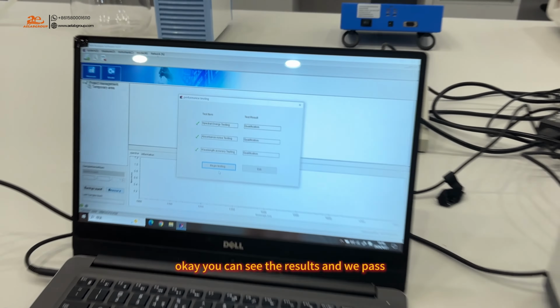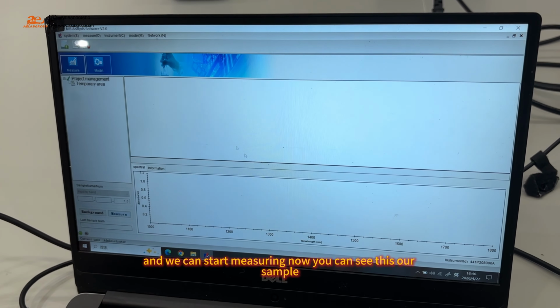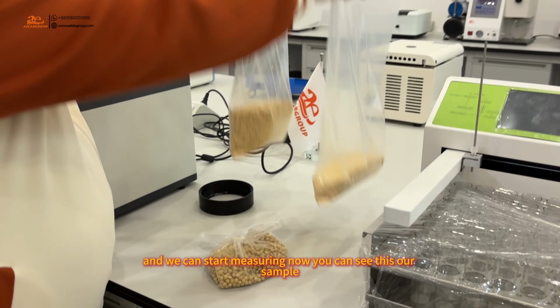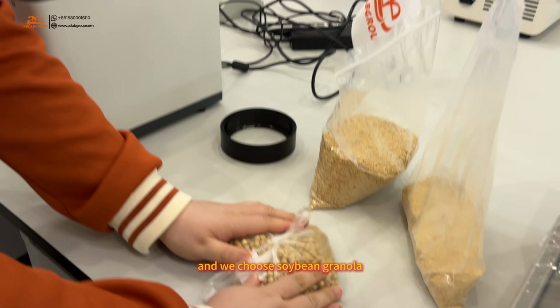Okay, you can see the results, and we passed. And we can start measuring now. You can see this is our sample, and we choose soybean granular.